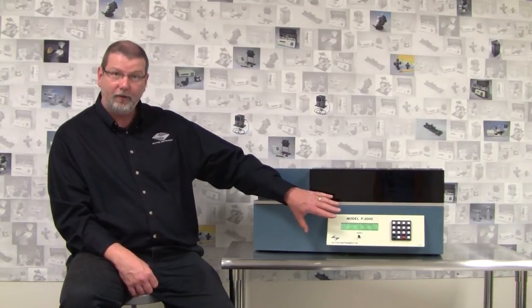Today we will set the baseline. That is, we will show what happens if you pull glass of a particular specification with a sample program, program number one, which produces a patch pipette. The tutorial videos will then use that as a starting point and show what happens if you change the parameters one at a time.